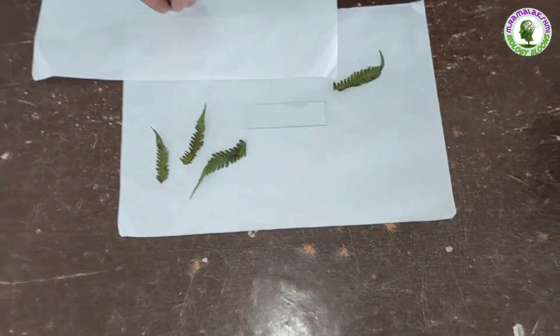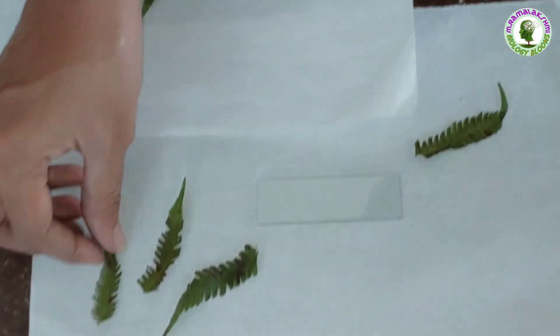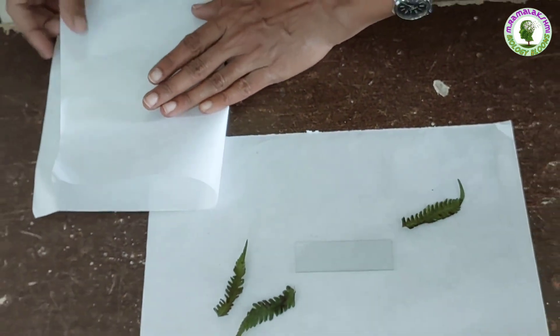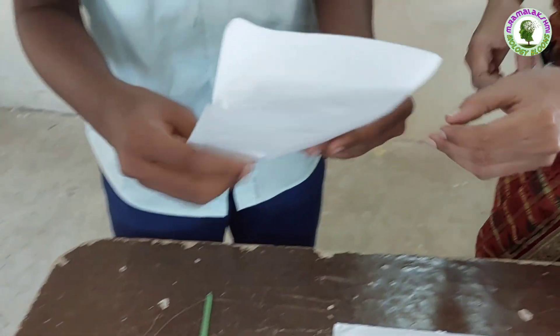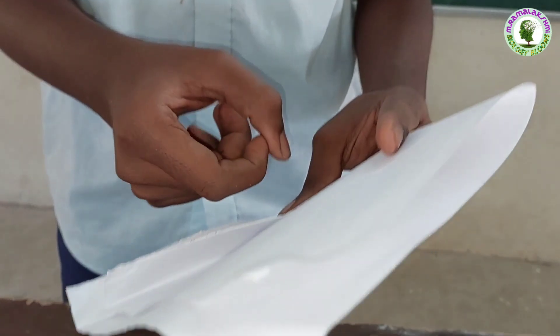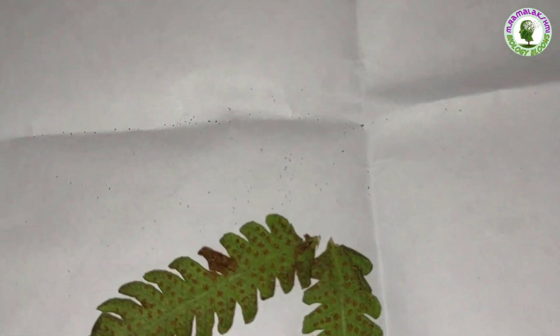In the second method, keep the leaf in the white paper and fold it like this. Now gently heat it. Now open the paper.